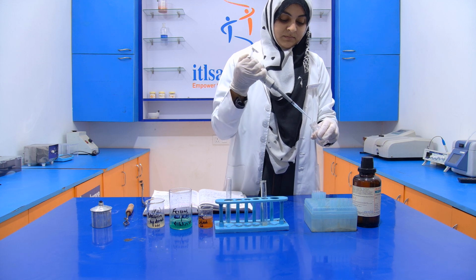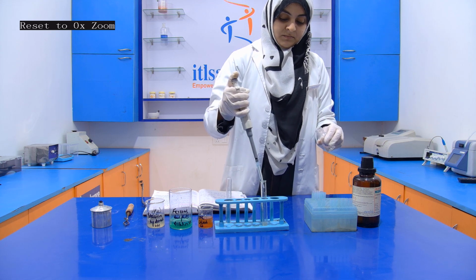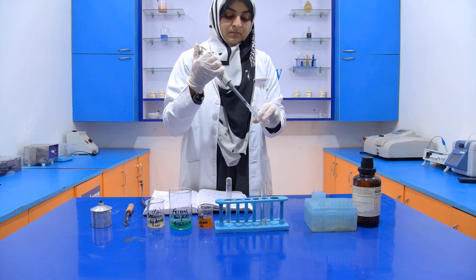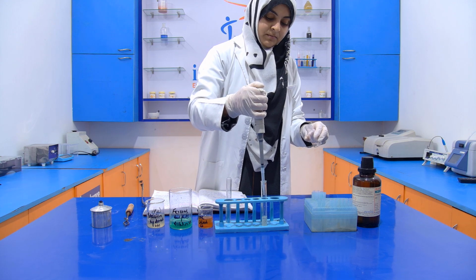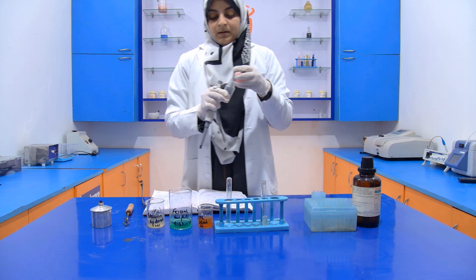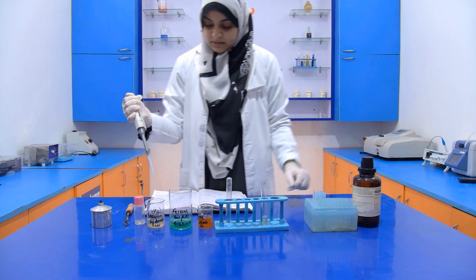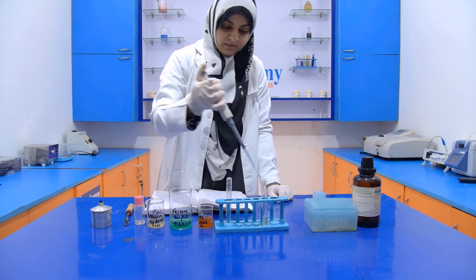One, two, three. Okay. Then after that, we have to add 1 ml of this potassium hydroxide.